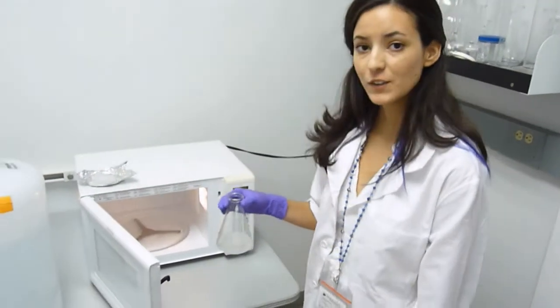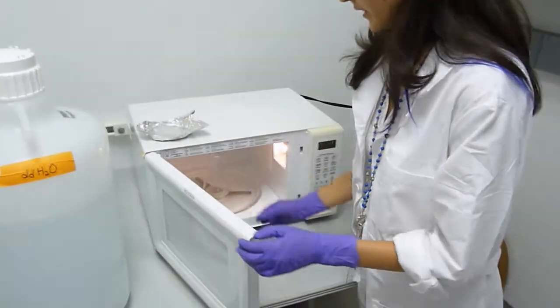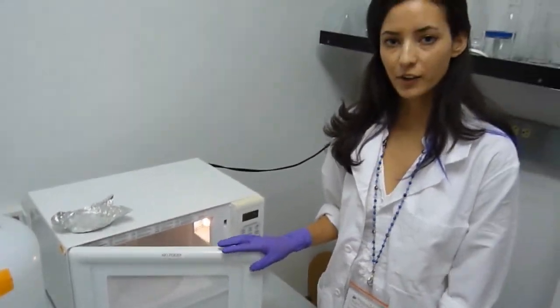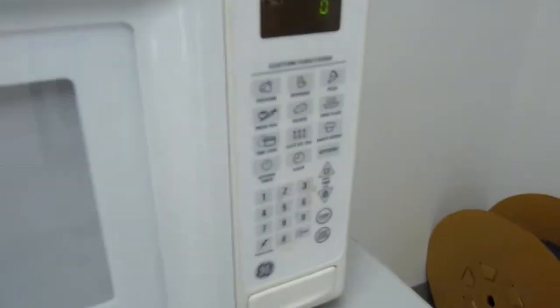Our agarose solution is ready to be microwaved. You can use a standard microwave for this procedure. Remember to be careful that your agarose solution doesn't boil over while you're heating it up. A way to prevent this is by heating it up in 30 second intervals.